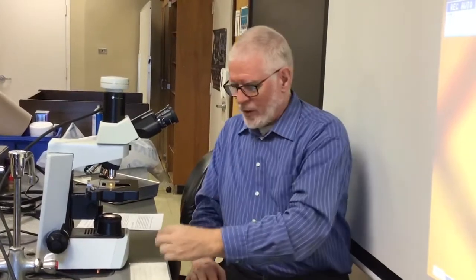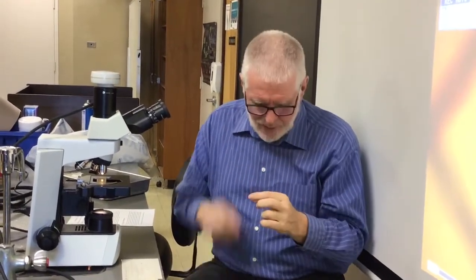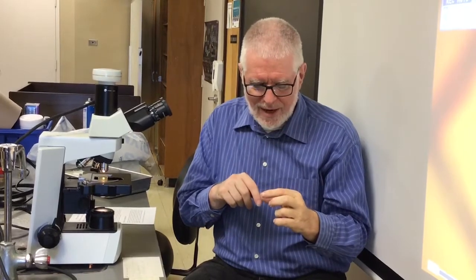One of the most important things you can do when you're going to work with a microscope, you clean your slide off. If you've got a cover slip, you clean the cover slip off. If the slide is already made with something on it, you hold it over a piece of paper, or you hold it up to the light and you look at it. Very often, I know you're looking through a microscope, but what you're going to look at is visible by eye. Like the three threads are visible by eye. So you look and you go, oh, it's up in the corner of the cover slip. Now I know where it is. I put the slide on here, I open up the iris diaphragm, and I move it until I see that thing I saw before light up.